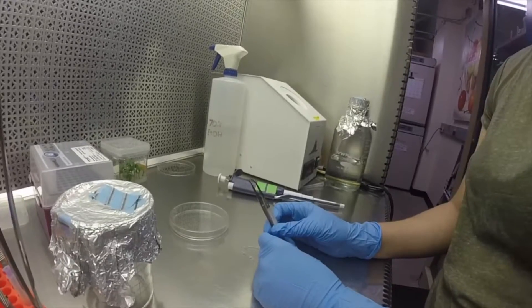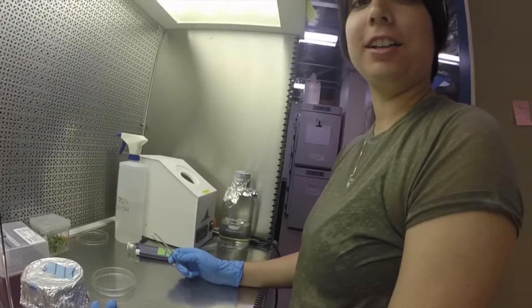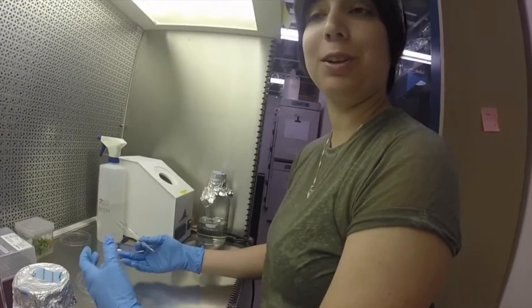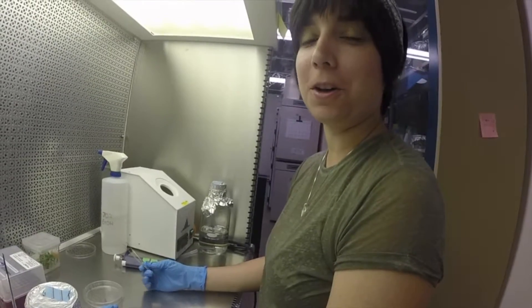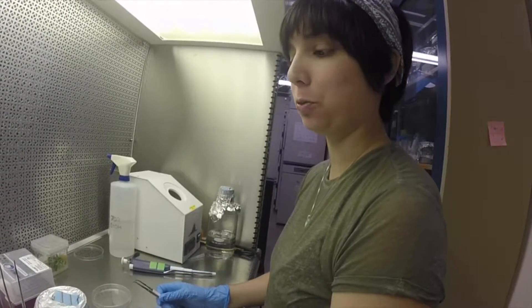Today we're going to be learning how to cut cotyledons for transformation. This is specific to the tomato protocol but it can be adjusted to other protocols as well.